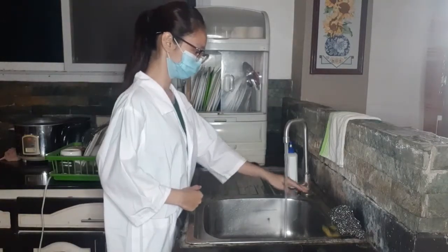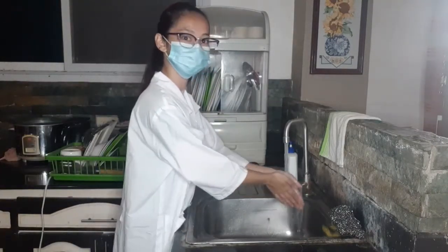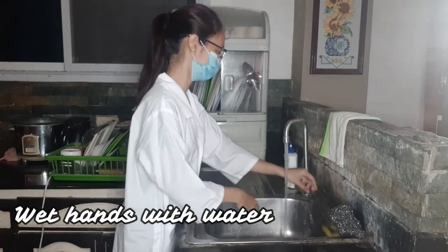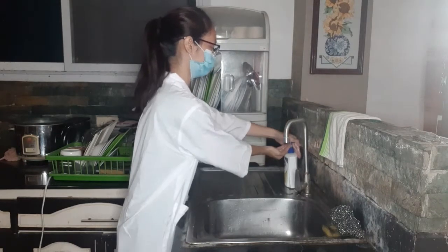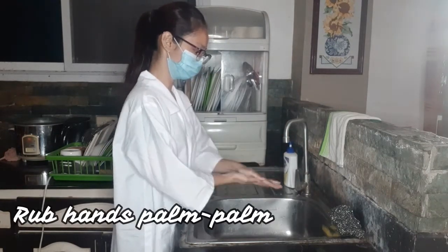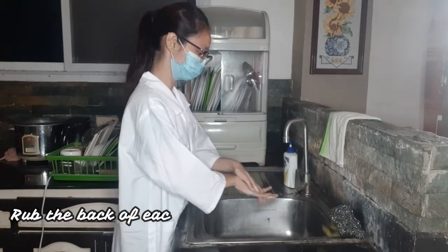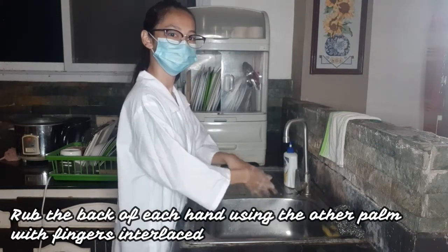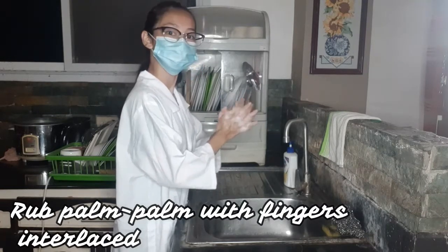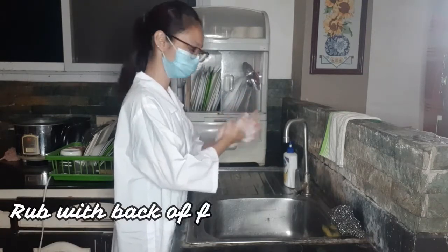Hand washing must be done before and after all lab activities, and it should be done properly in order to ensure that contamination is prevented in the laboratory. After soaking your hand, apply soap. Rub hands palm to palm. Rub the back of each hand using the other palm with fingers interlaced. Then rub palm to palm with fingers interlaced.